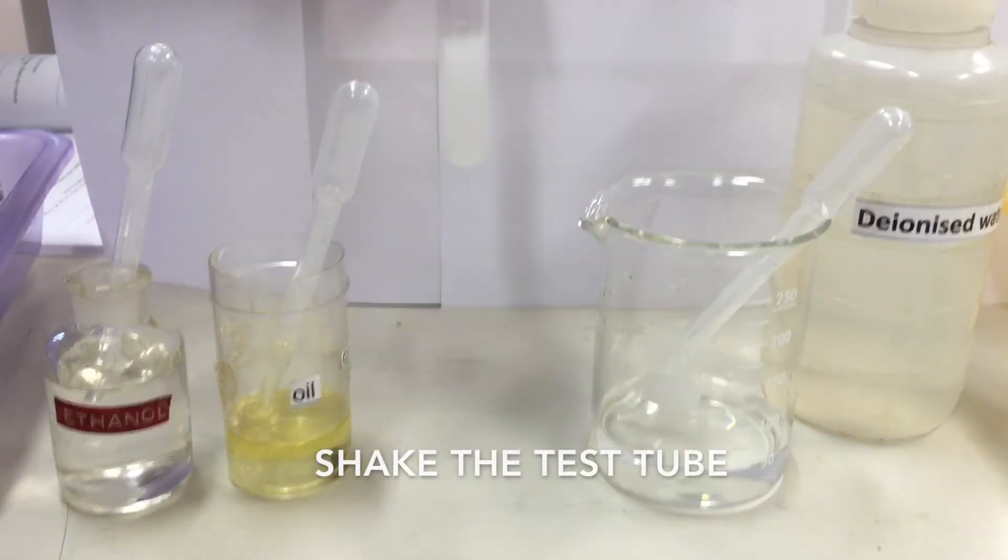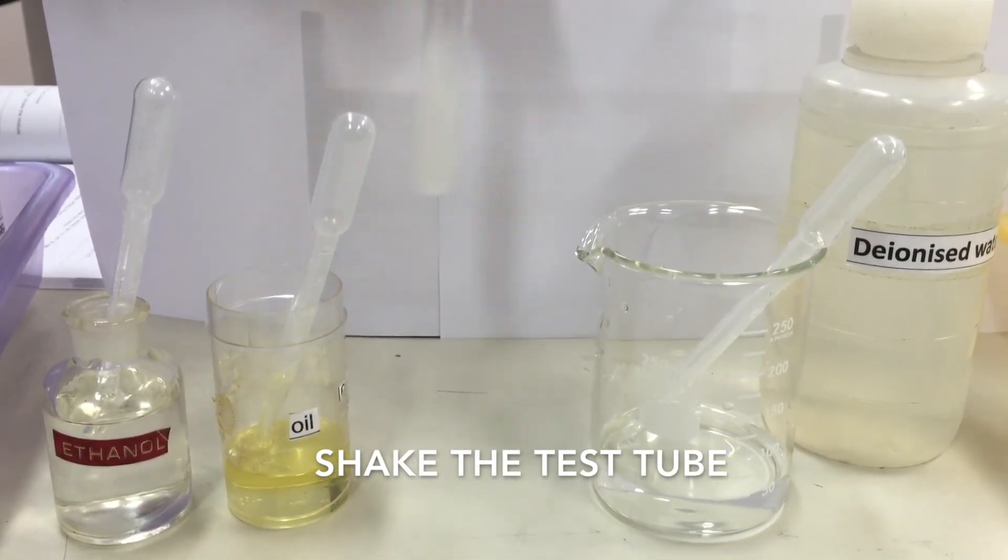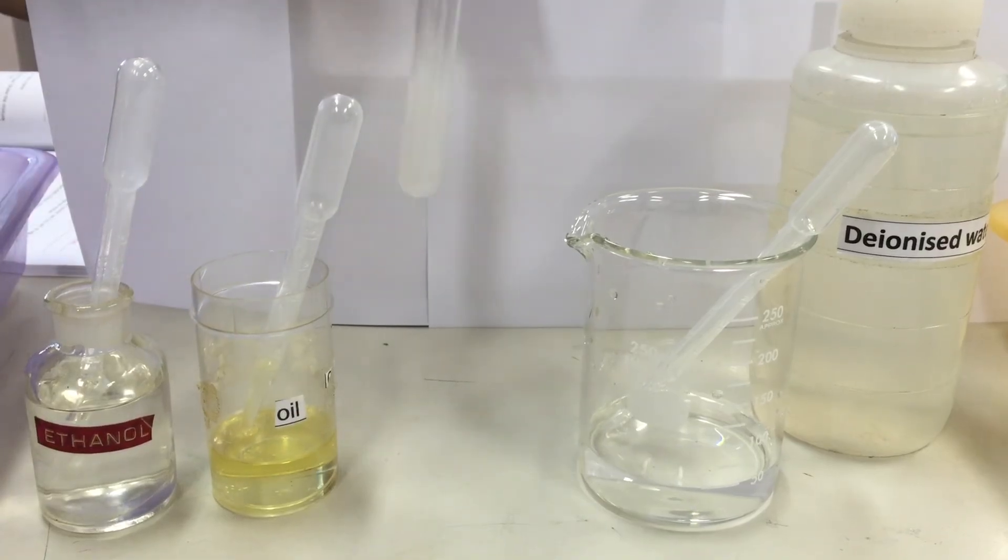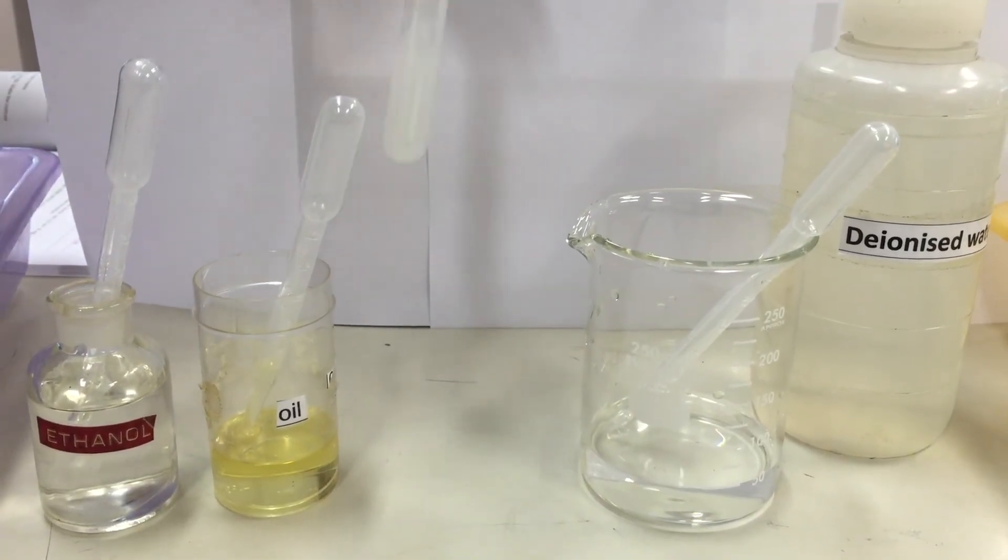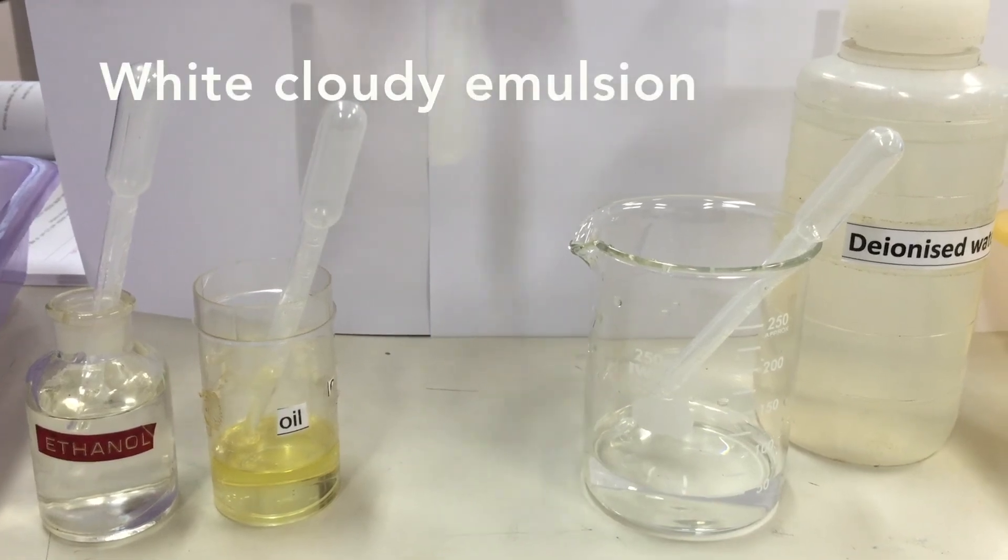We shake the mixture again. You will soon observe that a white cloudy emulsion is produced.